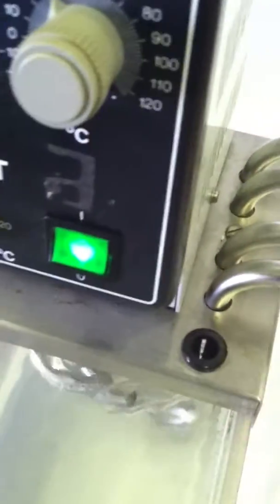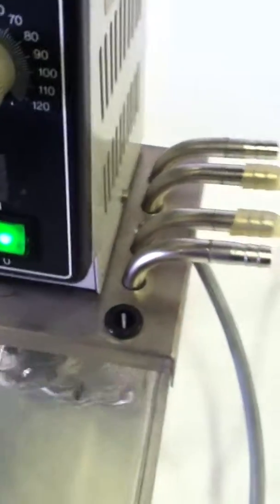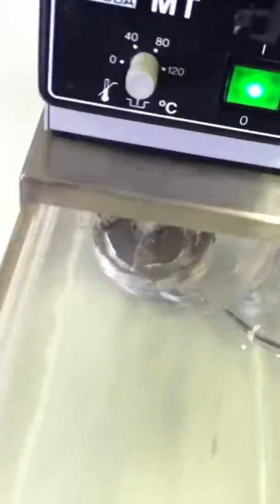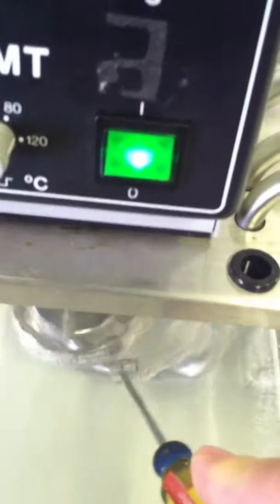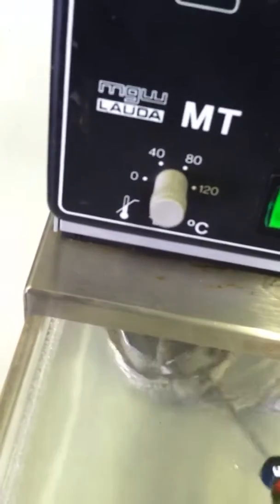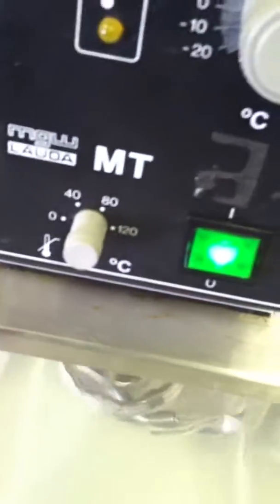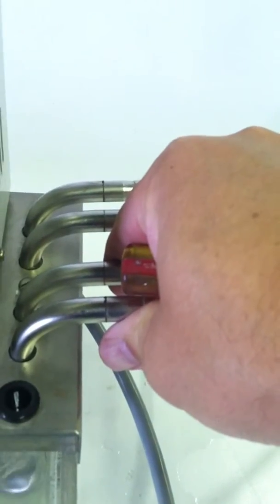That little rattling sound is just vibration. If I depress this a little bit, you'll hear it go away. What's difficult when you get these baths is that the position of the motor down here, where the impeller hits, will cause it to also make a little shift. But by shifting one or two, or maybe I'll even tie that up, it becomes very quiet. That'll work well.